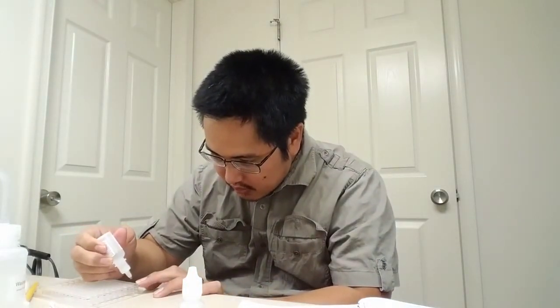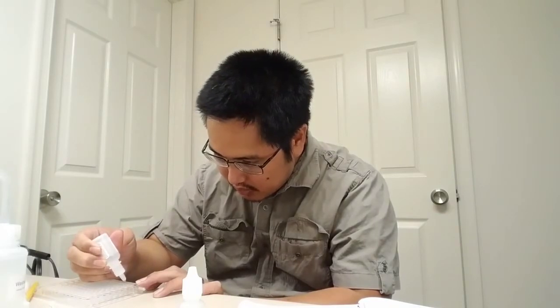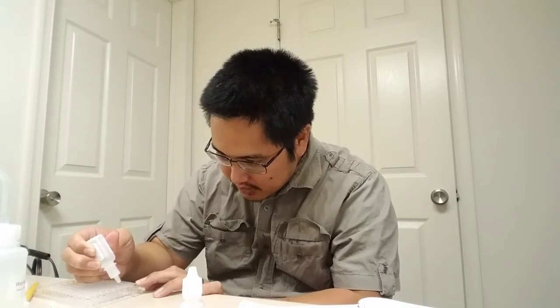So it goes 1 here, 2 here. This is a little bit harder because this is a clear liquid. 2, 3, 4 in D. 1, 2, 3, 4, 5 in E. 1, 2, 3, 4, 5. Awesome.